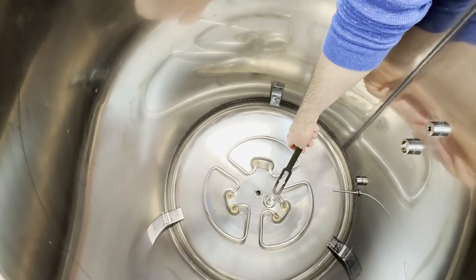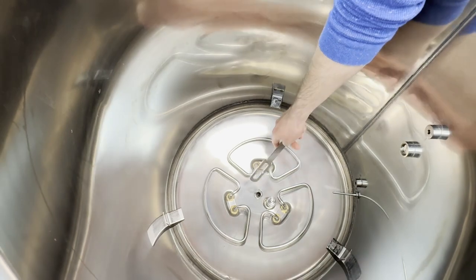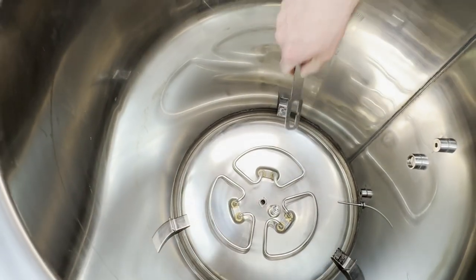You also want to make sure that the water is above your water level sensor but below your vent tube. This here is where your water drains out from.